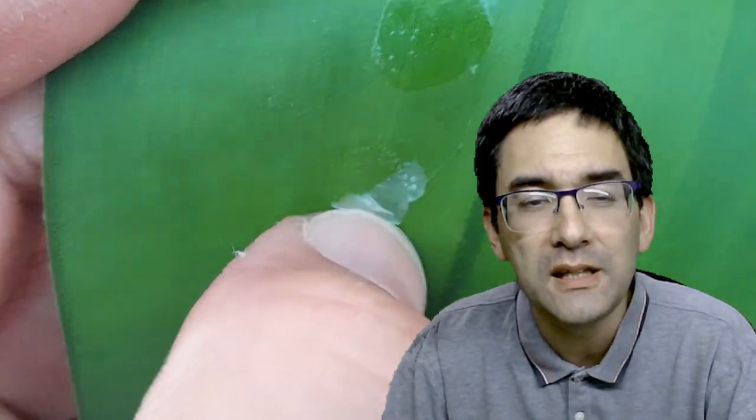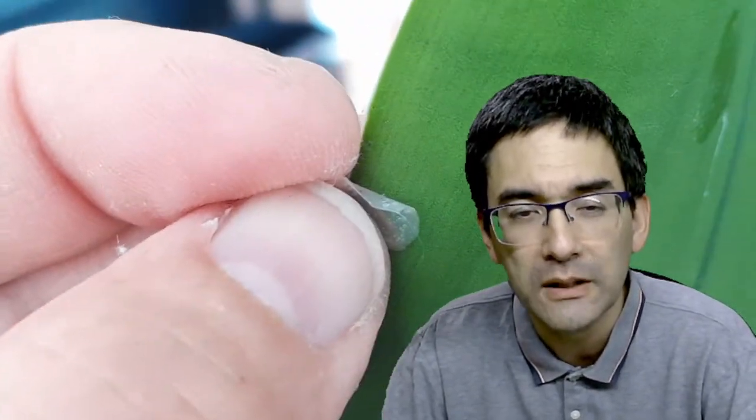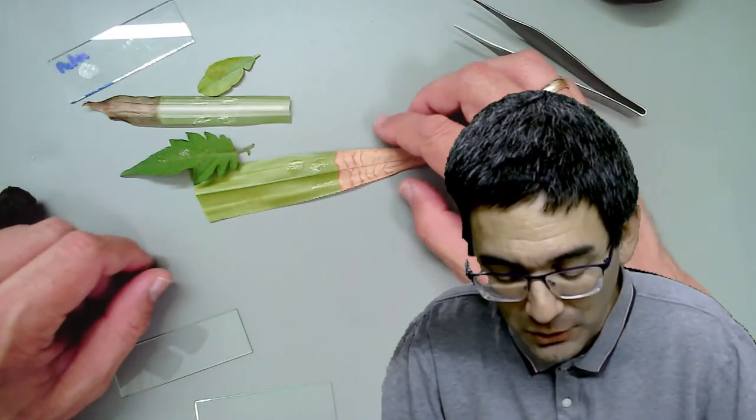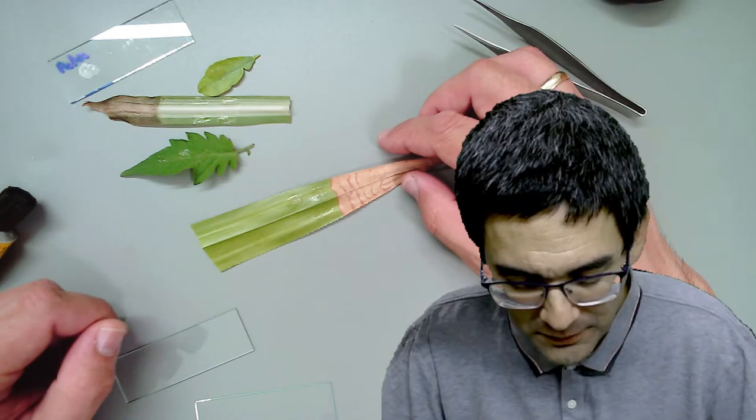Here's a planter with plants I have at home - I tried it on this little tree. I've also prepared two spots of glue on the bottom side of the leaf. As you can see, the leaf is extremely smooth and therefore it's quite easy to separate the glue. In a tomato leaf it's very difficult to peel off the glue again, so the choice of plant is important here.